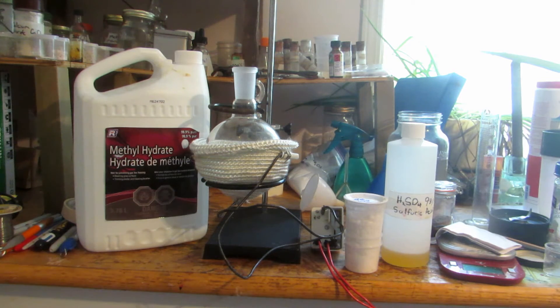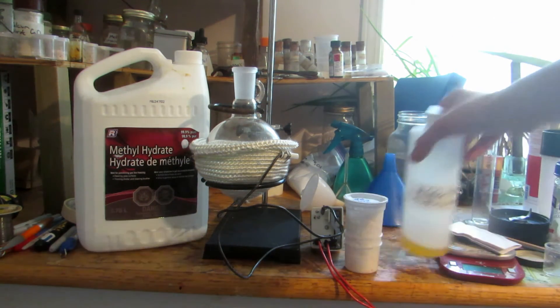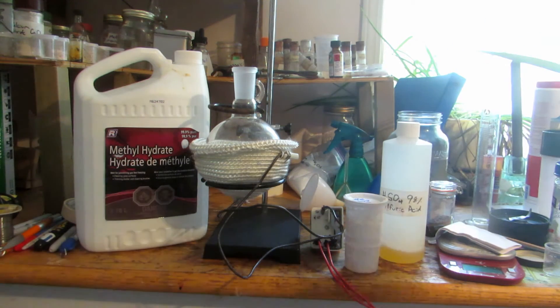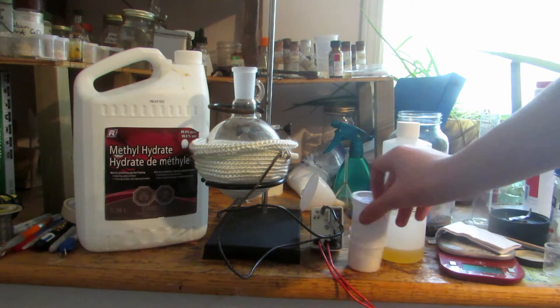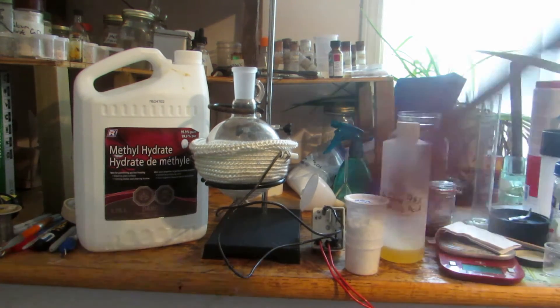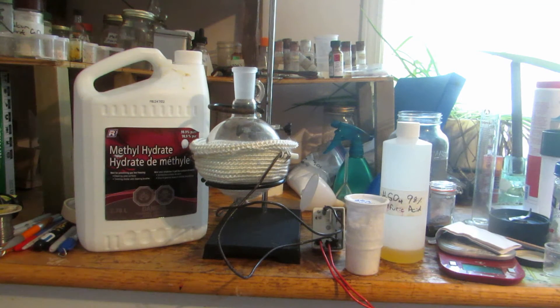To do this we'll need concentrated sulfuric acid, which we made in a previous video through distillation. It has some impurities because it was bumping while boiling, but it's pretty pure. We'll also need salicylic acid and methanol, which is sold as methyl hydrate at Home Depot or Canadian Tire.